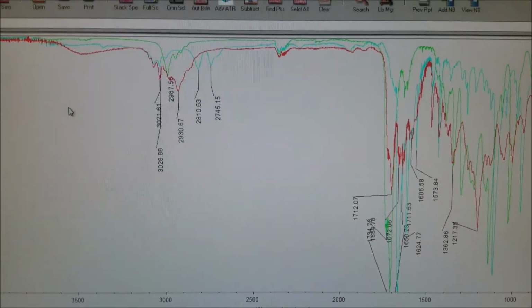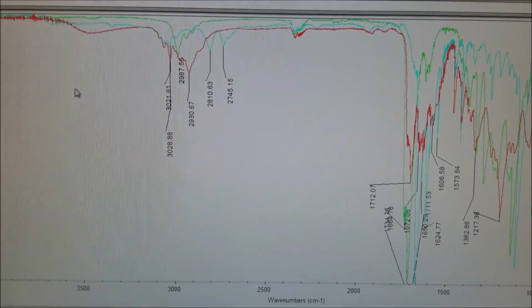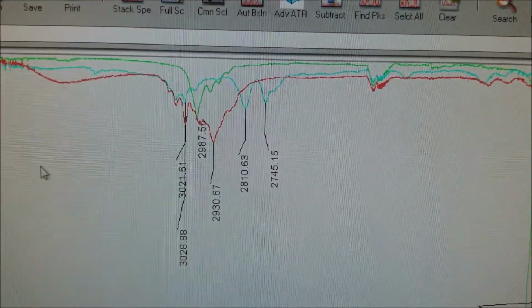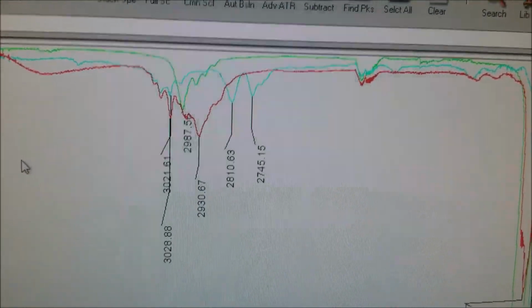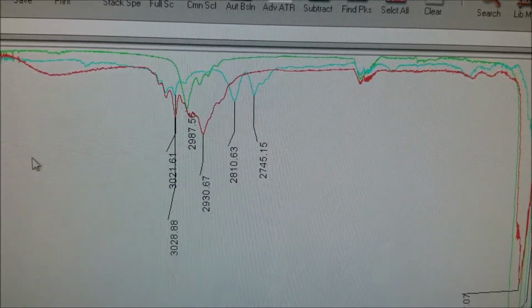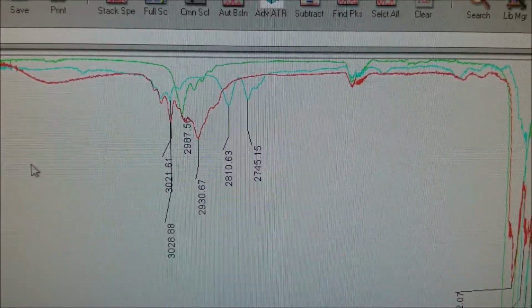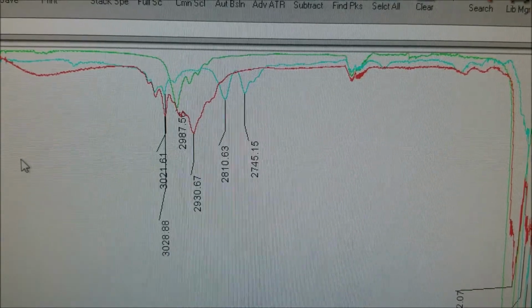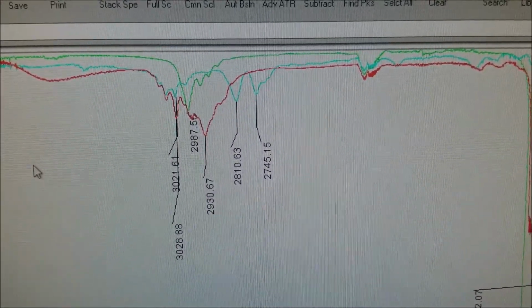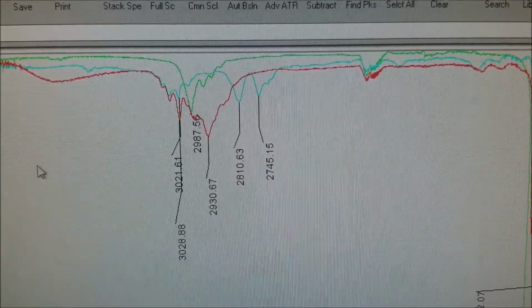As you can see in this one, I overlaid the three spectra so you can see where there are similarities and differences. You can see the blue spectra almost perfectly overlap in the sp2 hybridized region. The ethyl acetoacetate CH3 sp3 hybridized peaks are not in the same positions. They are new and unique. And those aldehydic CHs are definitely different from what we have.